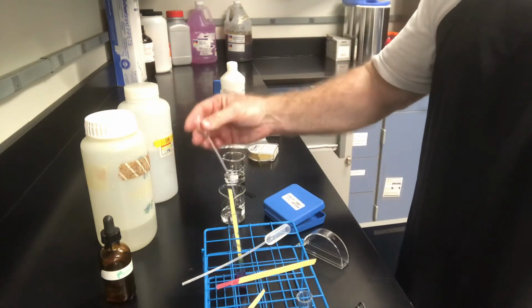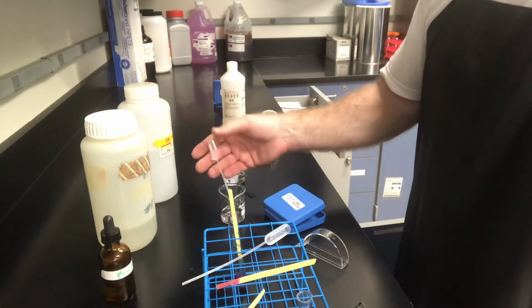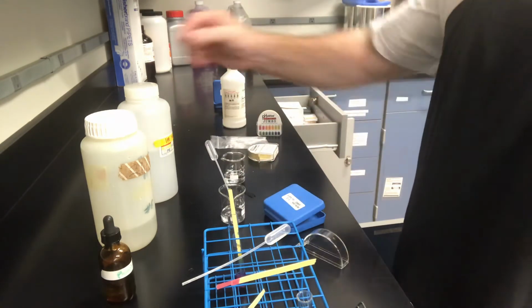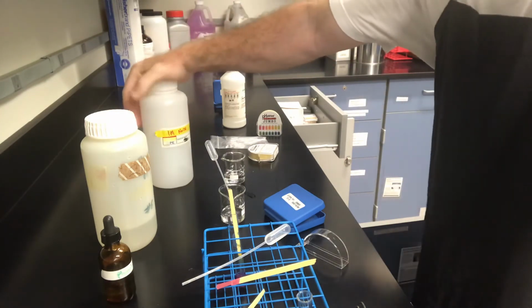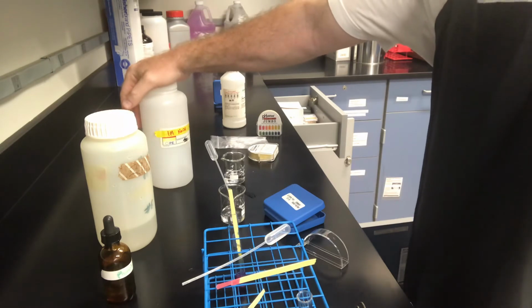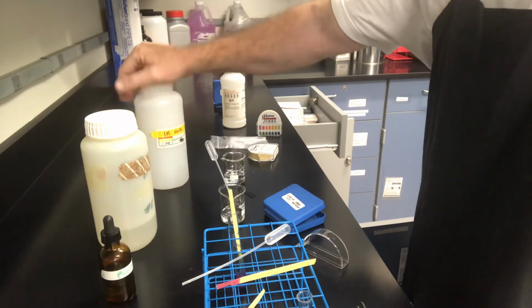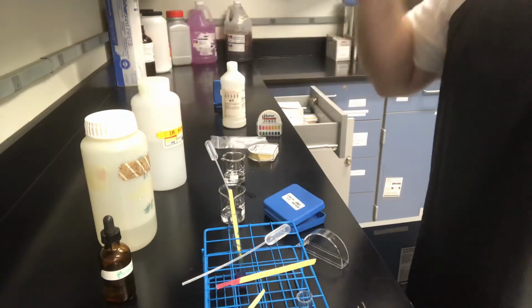I'm dropping from little plastic pipettes, trying to get equal drops, but they're just not all equal. Sometimes the air gets caught and it messes up. The other thing too is my NaOH was, I know it's not 1 molar. It's more like 0.91 if I remember doing the titration with this.